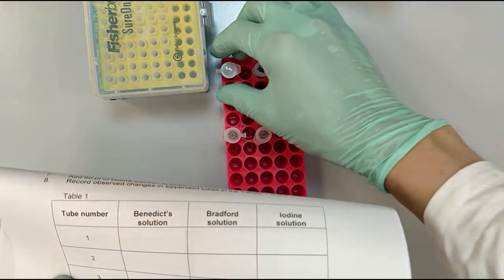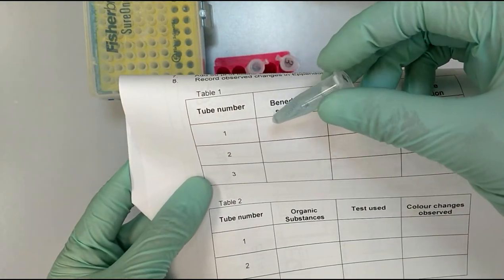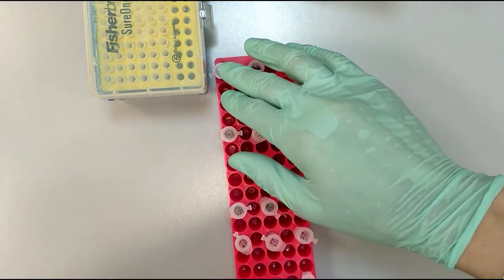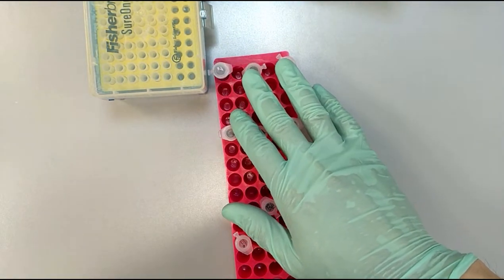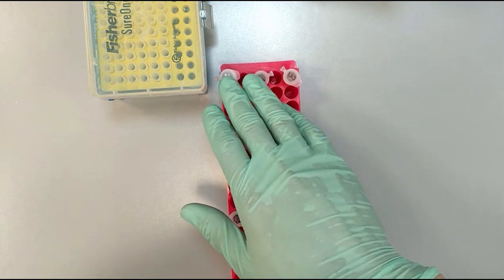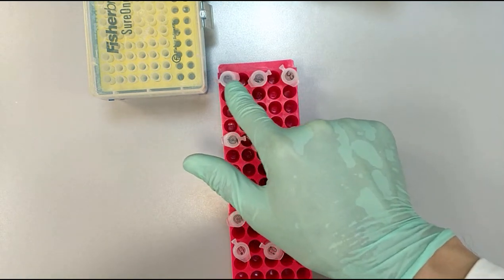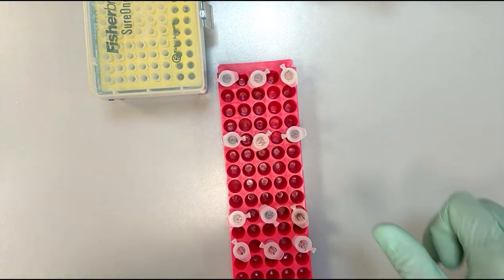The same goes for each of the other rows, so for example, after we added the Bradford, we need to wait 10 minutes. So for now we have another 2 minutes to wait and see if the reaction happened in any of these secret solutions.